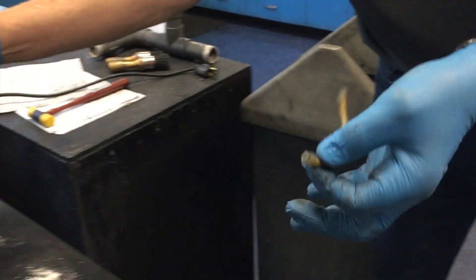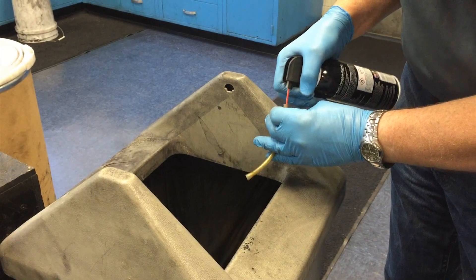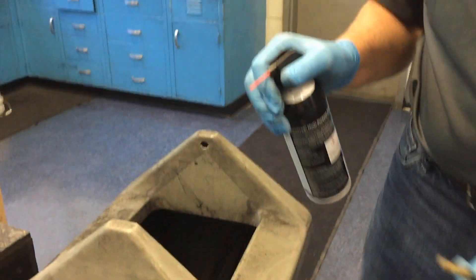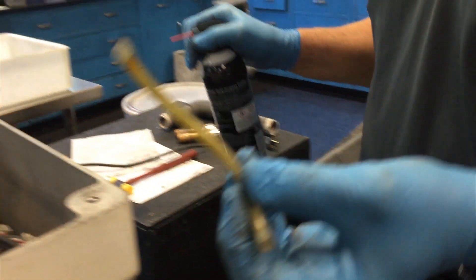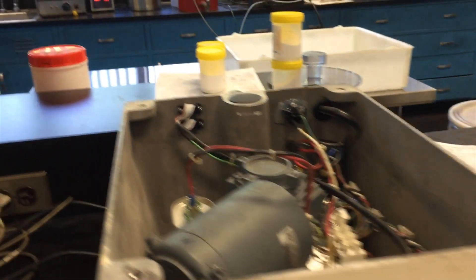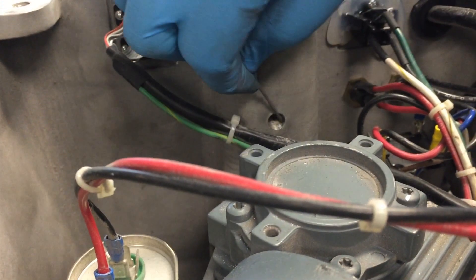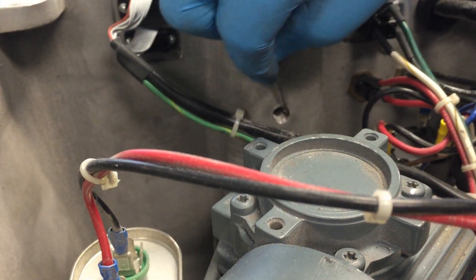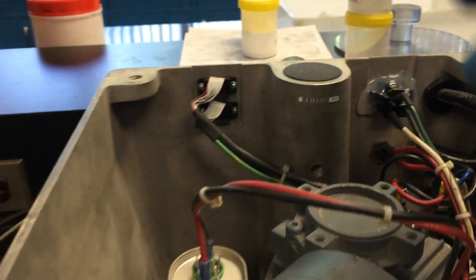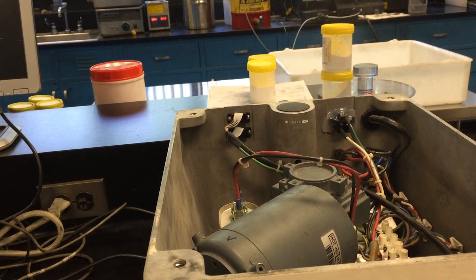Most importantly is the hose. You want to make sure that the hose is clean, and I like to go from both sides, only because it gives you positive acknowledgement that the hose is clean. Last, and equally as important, make certain that the threaded area is free of material. That can be done with the opposite end of the Allen wrench, or if you can reach down inside, blow it out with the canned air.